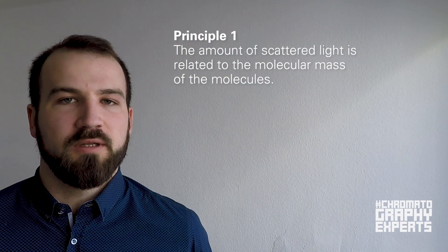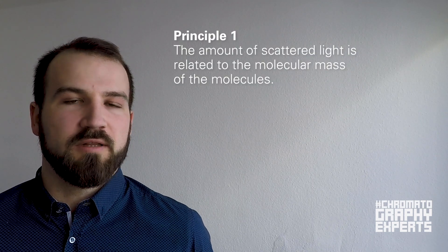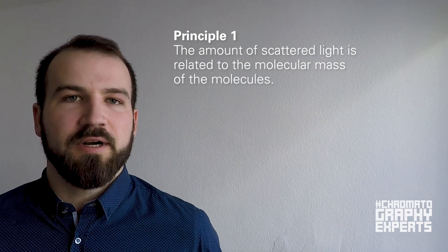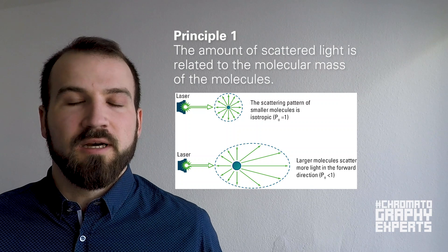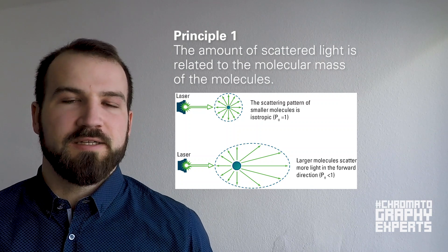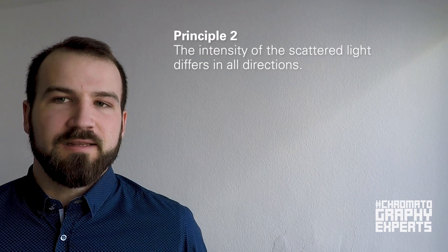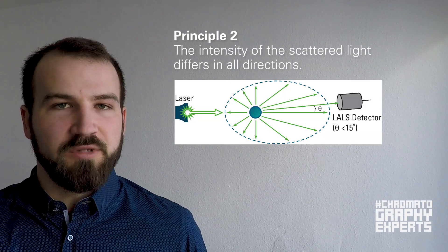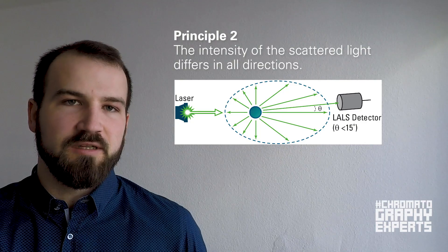The first principle is that the amount of scattered light emitted by each molecule is directly related to the size of the molecule — the bigger the molecule, the more light is scattered. The second principle is that the amount of scattered light from each individual molecule differs depending on direction.